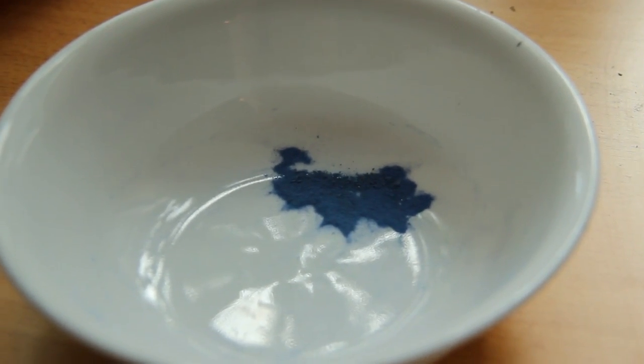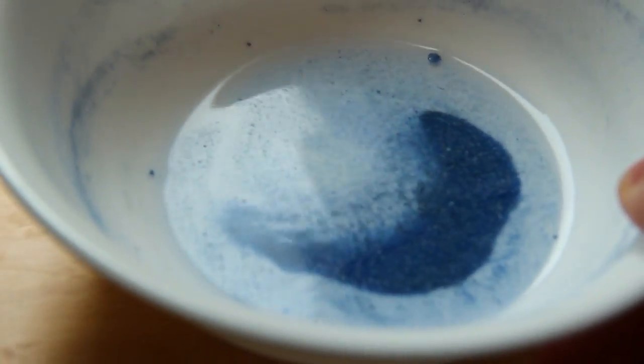And here is the result. Here is some of the higher quality stuff, and here's a paler shade of blue. I was able to make the pigment relatively pure by washing it repeatedly and drying it out. I had to almost pan it like you would pan for gold — the wax and resin particles would concentrate in particular locations, and I could take them out with my finger, just a small amount at a time, without taking away too much pigment.